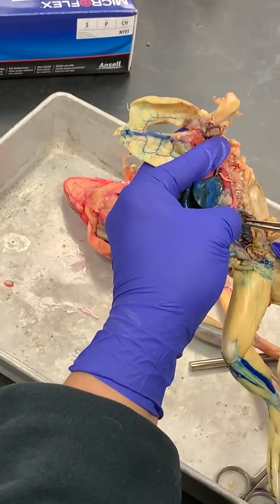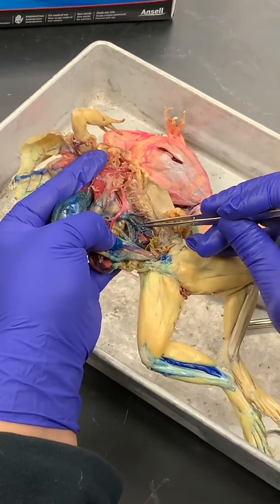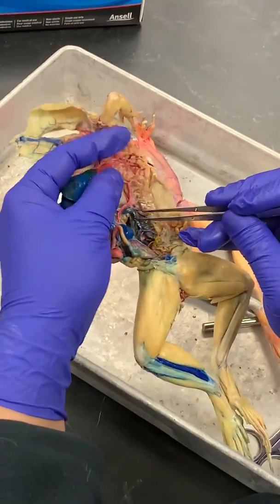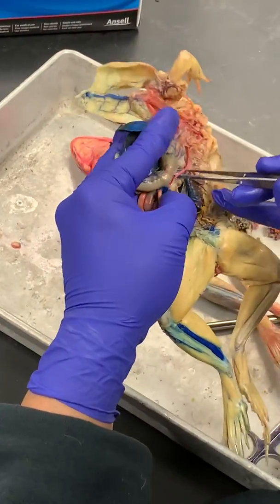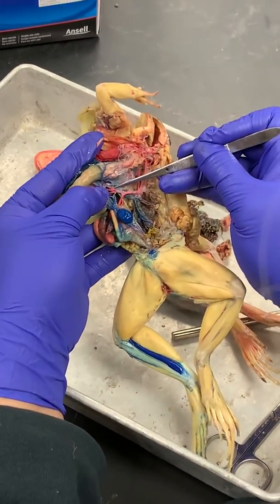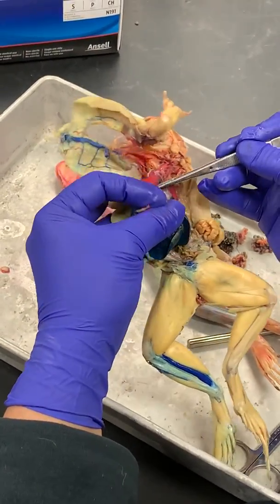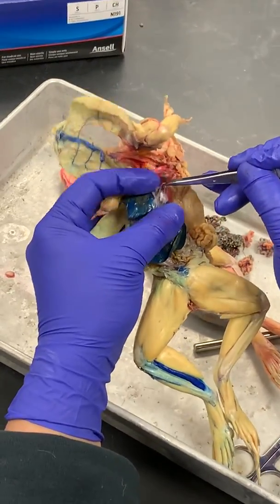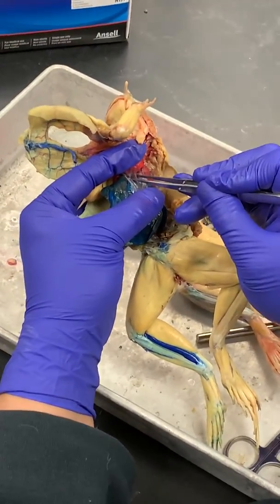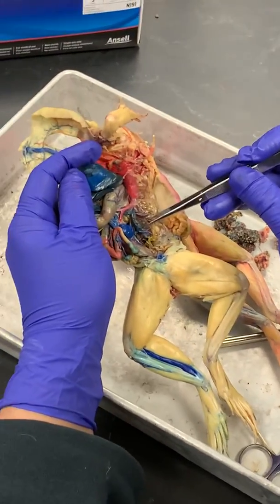If you peel some of this mesentery away, you can see that there are little blue veins coming from the kidneys and into the post cava. These are the renal veins. So my post cava, if we follow it here, continues on up into, look at how big it is, the liver, and then it's going to emerge in the sinus venosus underneath the heart. Here's the sinus venosus. All right. So ventral abdominal vein, post cava with the renal veins.